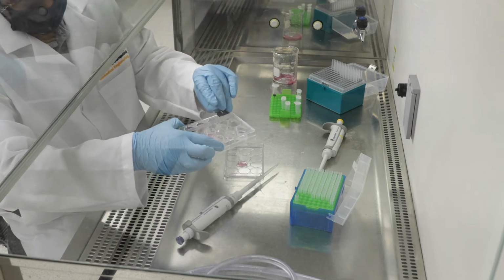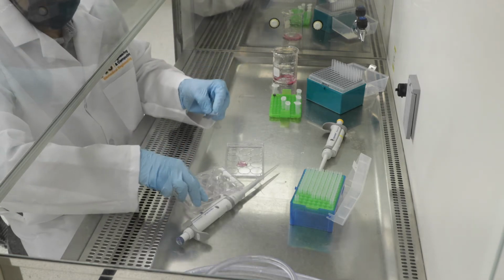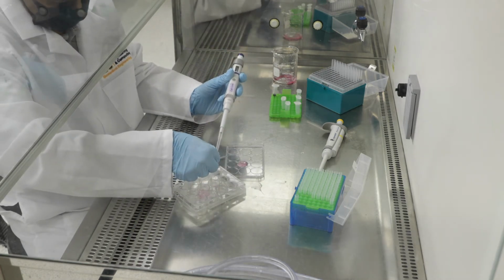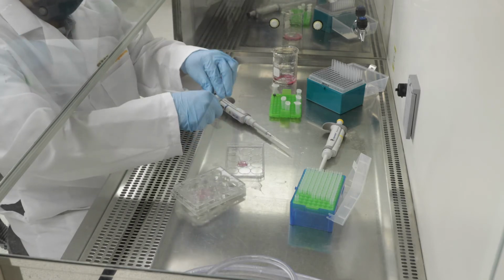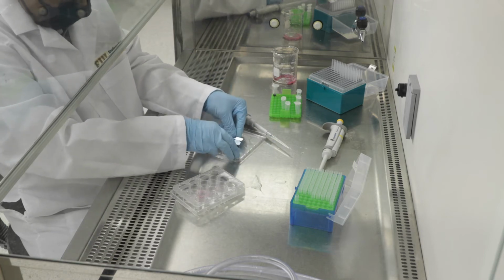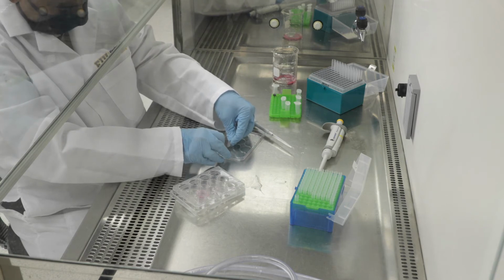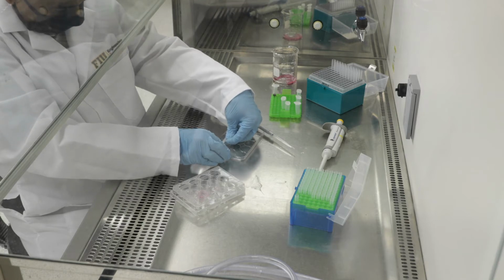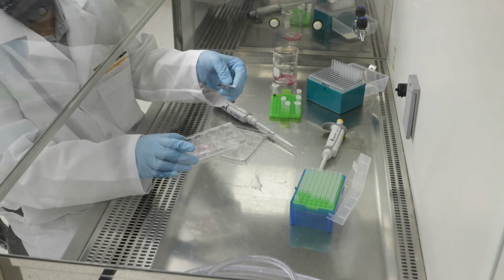thinner. One way you can measure the thickness of your sections that you cut here with the razor blade is to use a microcaliper, which will then show you what the exact thickness would be. Here we're sort of ballparking it, and if you've done this with sufficient experience, you sort of know how thin it has to be. Again, the thickness would be in the range of about 150 to 300 micron for a regular bright field microscope.